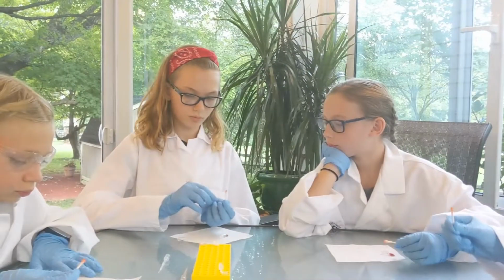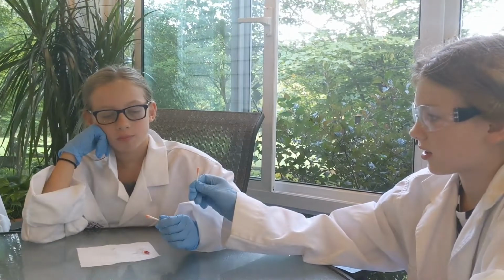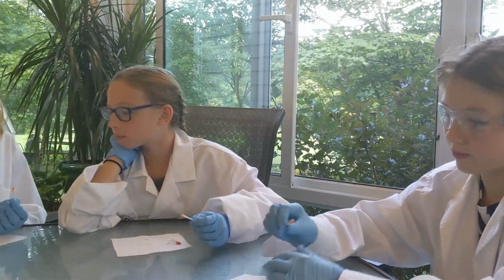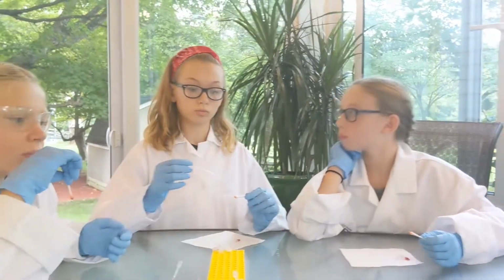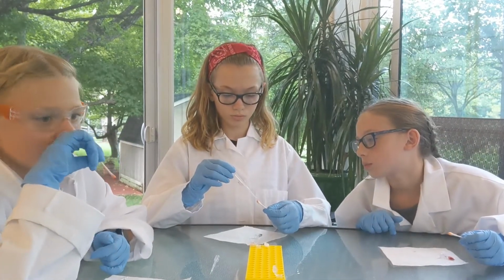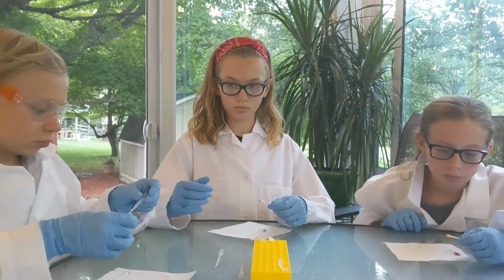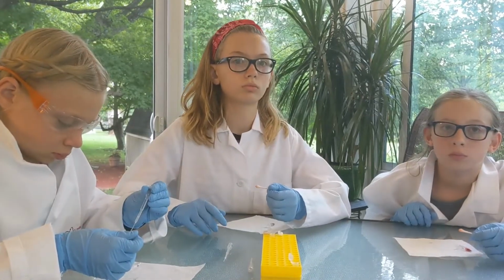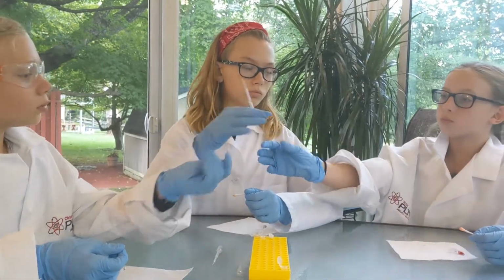So phenolphthalein is most well known as an acid-base indicator. It stays clear if something's an acid, but it turns a nice pink color if it's a base. And that's the same color it's going to turn in the Kastle-Meyer test when we add the peroxide if there's iron, which could mean blood. But it could be something else with iron too. It's important to know this test is not 100%. It sometimes will suggest that something's blood even if it's not. So that's why it's called a presumptive blood test. It's not a for-sure blood test.